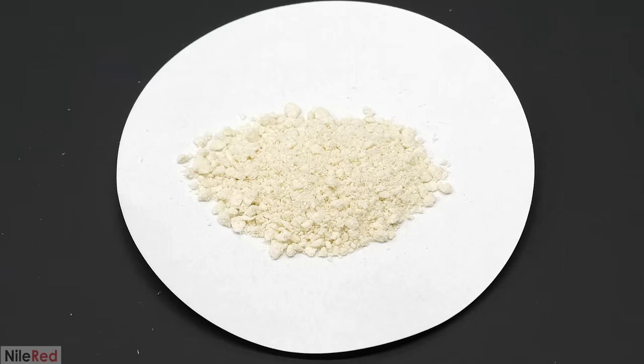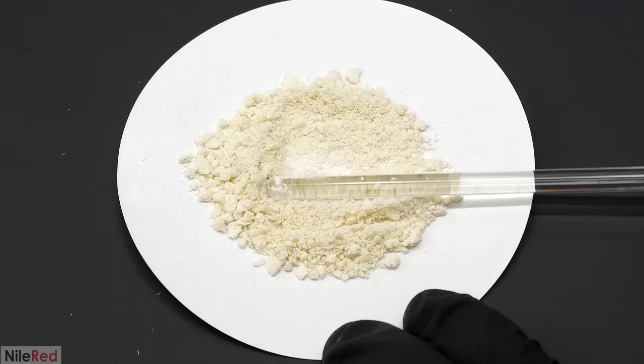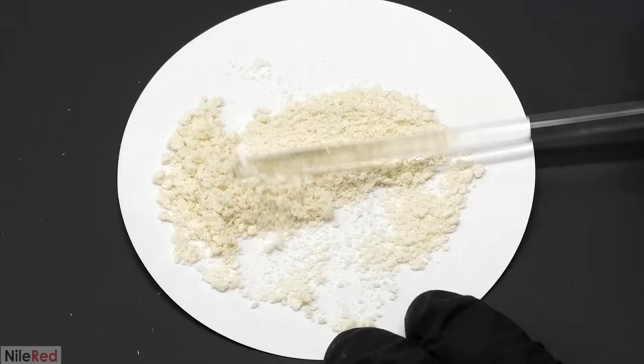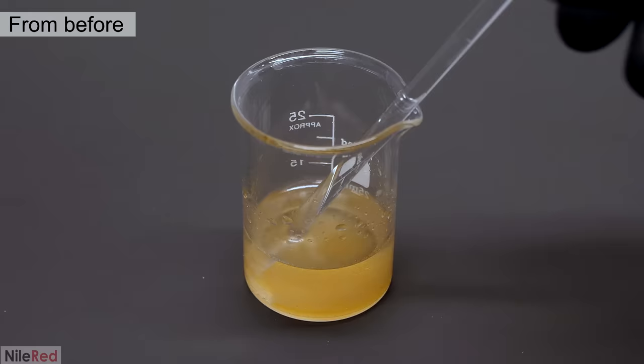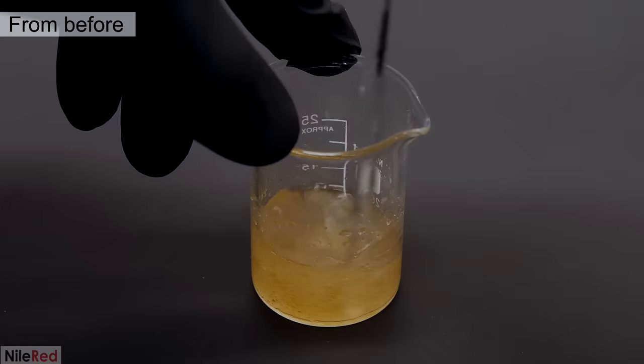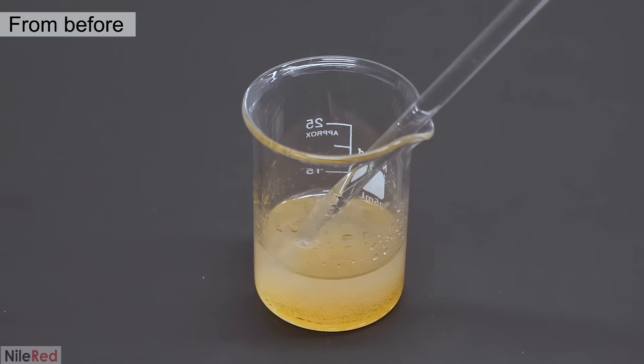The incredibly low yield aside though, what did surprise me was how little this powder smelled. The odor was really faint and not overpowering at all unlike some other compounds that I've made. I also wasn't getting any of that characteristic blue raspberry smell and it was mostly just a sweet fruity one. Because I wasn't able to do a proper recrystallization I wasn't sure how pure this stuff was. I was also a bit concerned because when something fails to crystallize it can sometimes mean that there are a lot of impurities present. To figure out its rough purity though I just had to do something called TLC.